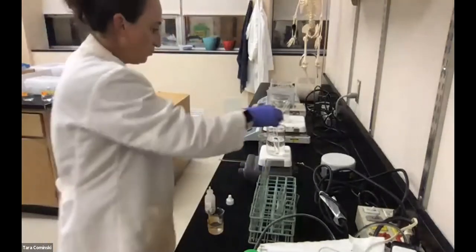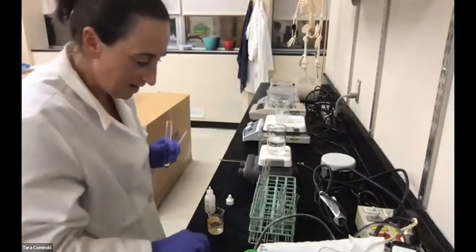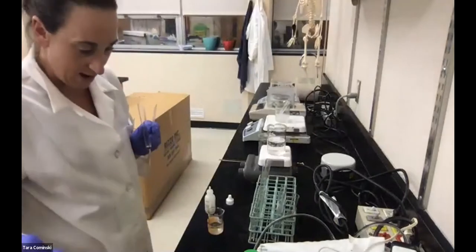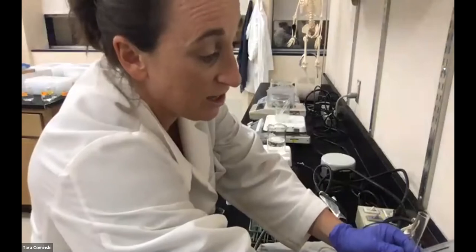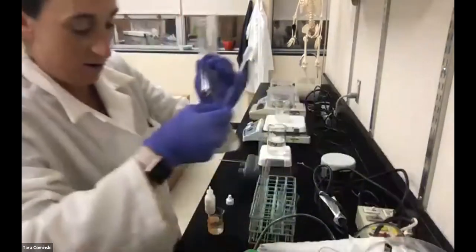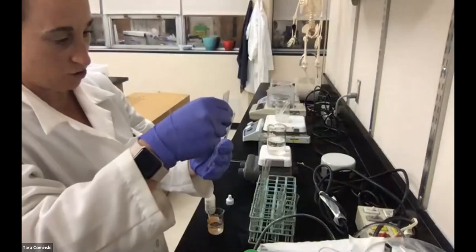Now let's go to tube 2, which is at 37 degrees Celsius. Let me now add the peroxide. Let me keep my transfer pipette in the peroxide so I don't mix them up. So let's go with this one, and I'm going to have this ready here.